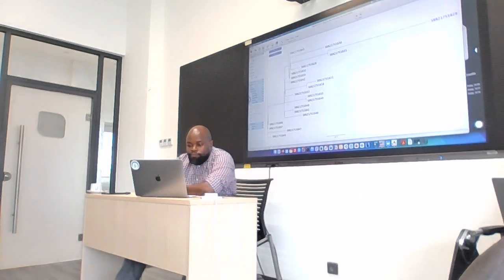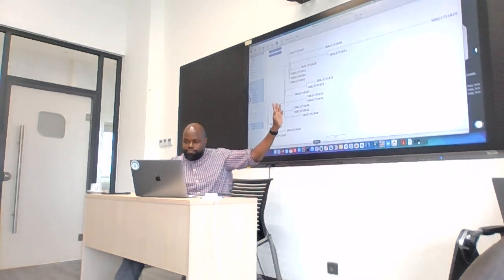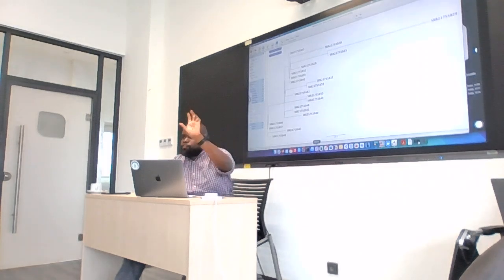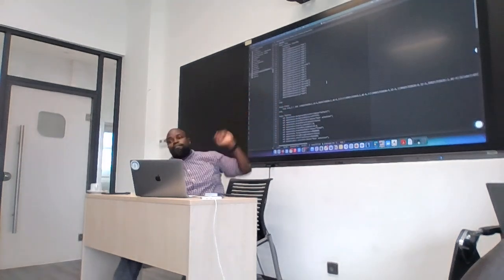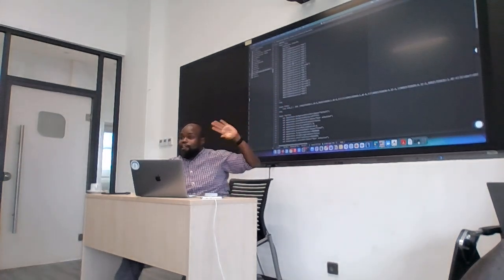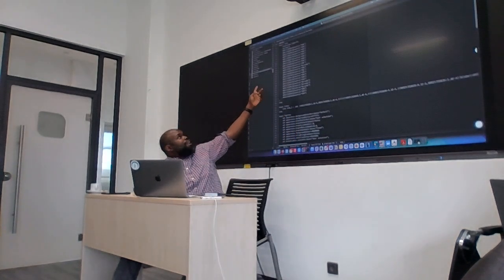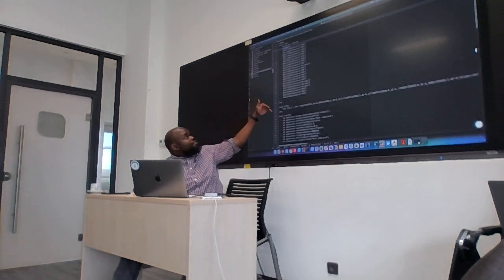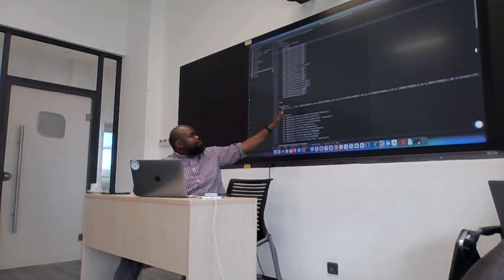Okay. Now, you remember I opened this file and it was only Newick. But I've given them a new annotation, metadata, and saving. Now, this is the same file. Can you see what has happened? Now it's a Nexus file. At the beginning it says Nexus, begin taxa, dimension, we have 22 sequences, and it's giving taxa labels. So the list of sequences here, and then we have metadata, country, US, country, Burundi, country, and then we have a section here that calls the tree.